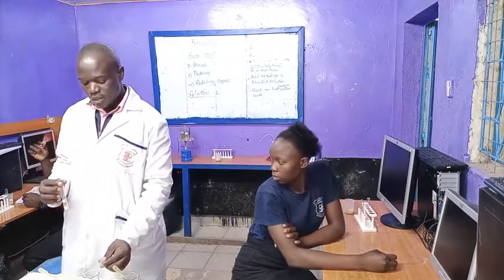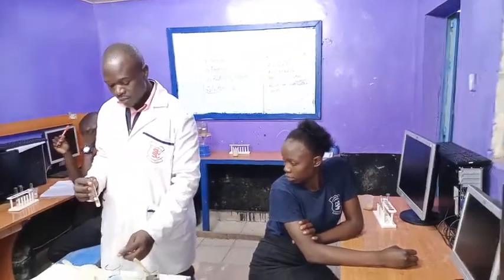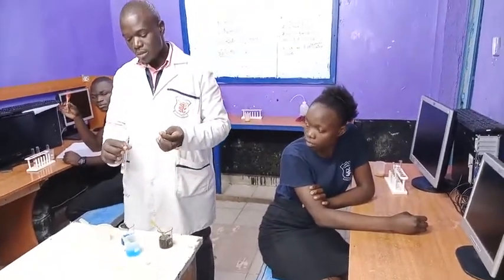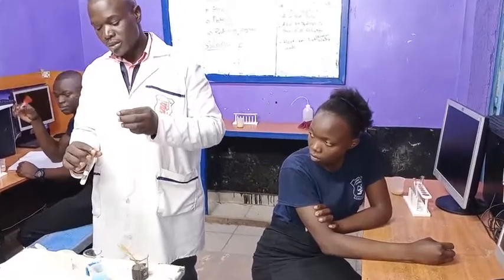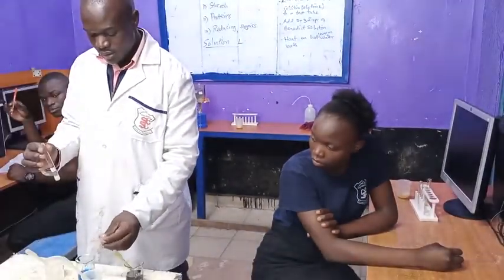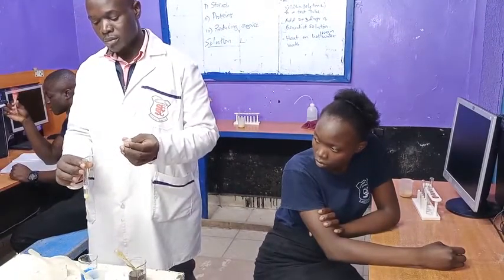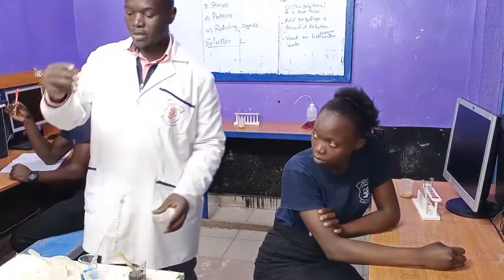Now we are going to add 2 to 3 drops of Benedict solution.